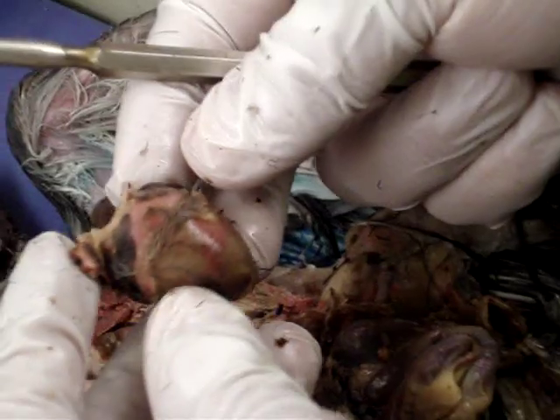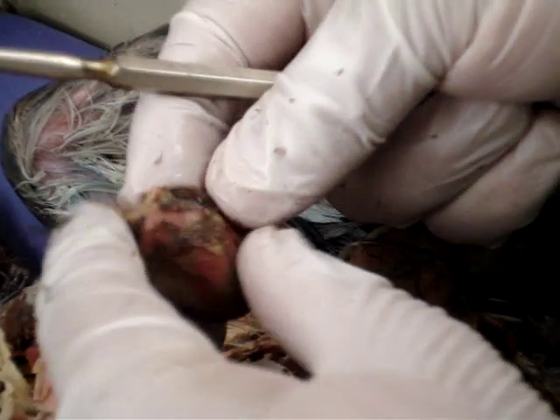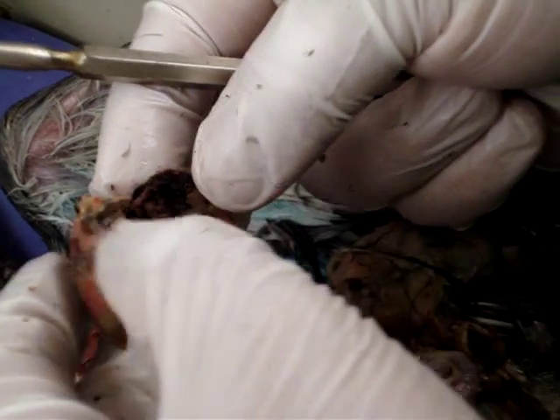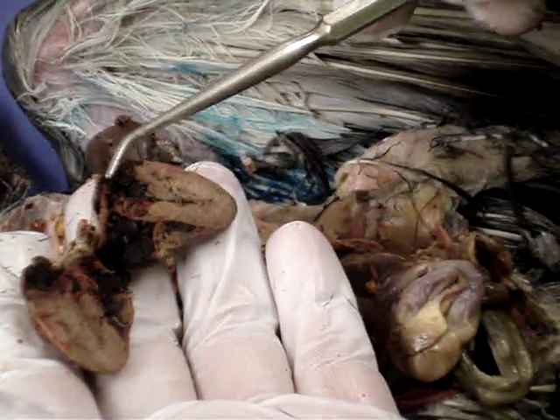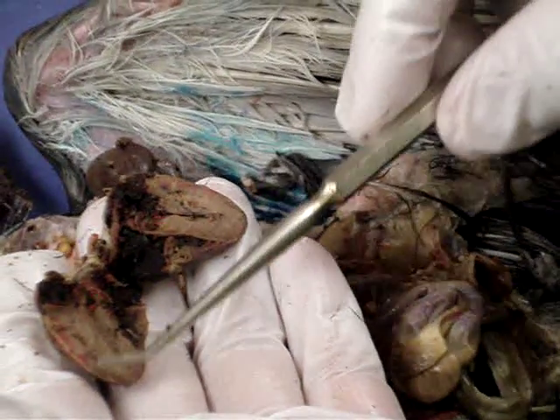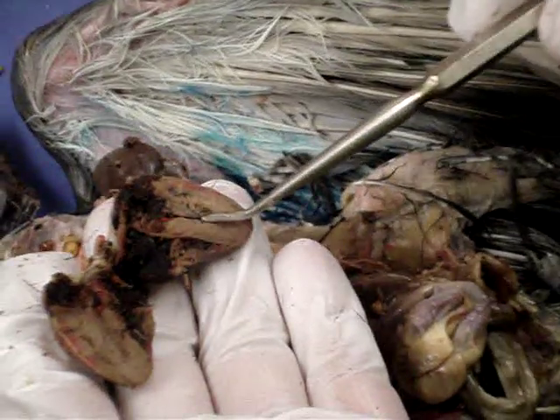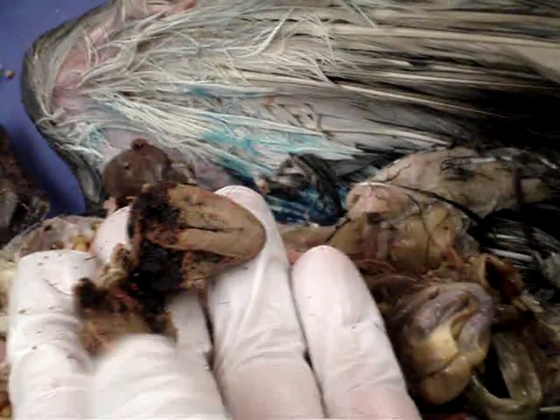Looking at the heart, by splitting it open, we can see the atria, which are the dark sections, and the ventricles, which are the light-colored sections. The pigeon has a four-chambered heart.